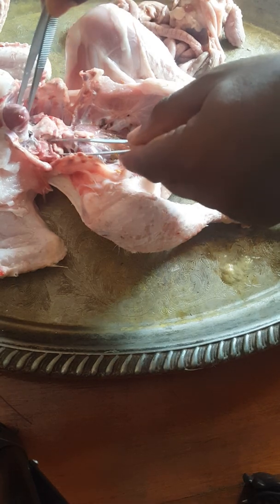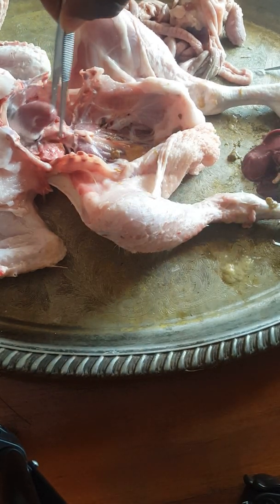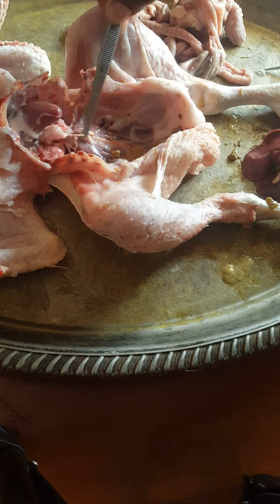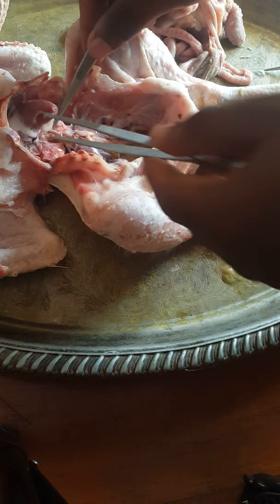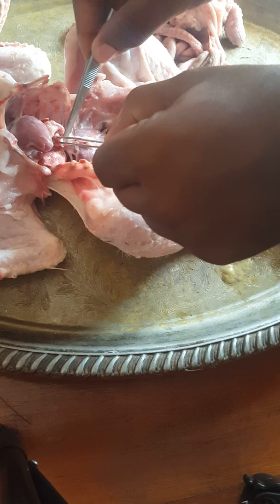We're going to have a bifurcation of the trachea here to form the two main bronchi somewhere up here. And this is a less prominent structure. This, we can see, is the esophagus that we got when visualizing the digestive system. Now I can remove the lungs here.